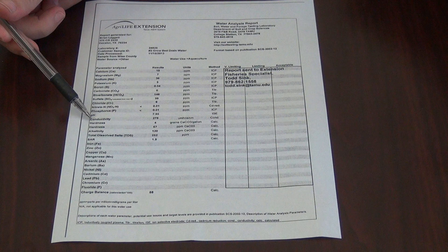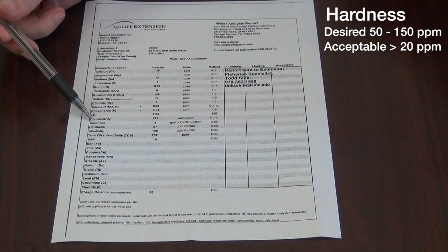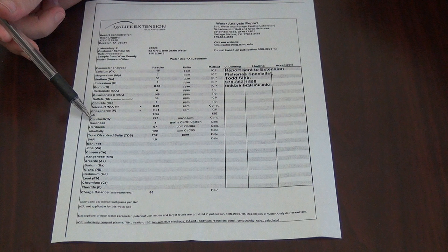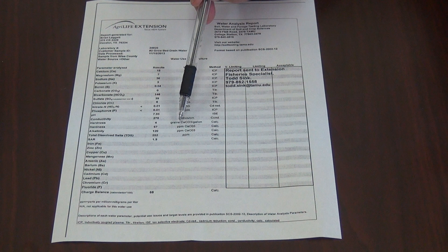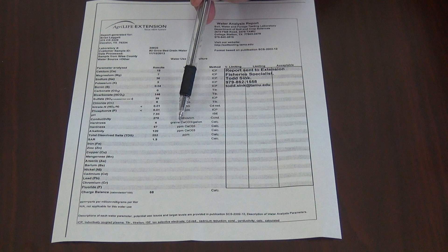Here we see hardness, which is strongly linked to the calcium and alkalinity content of the water. Optimal hardness is between 50 and 150 parts per million; however, the acceptable range is more than 20 parts per million. If the hardness and alkalinity of your water is too low, a common amendment is to add agricultural lime. If the alkalinity is within the desired range, add gypsum to boost the calcium hardness. One point of confusion on these reports is that hardness is listed twice — as grains of calcium carbonate per gallon and as parts per million of calcium carbonate. Our concern is the hardness in parts per million of calcium carbonate. Each grain of calcium carbonate per gallon is roughly equivalent to 17 parts per million of calcium carbonate, so they're basically two different ways to measure the same thing.